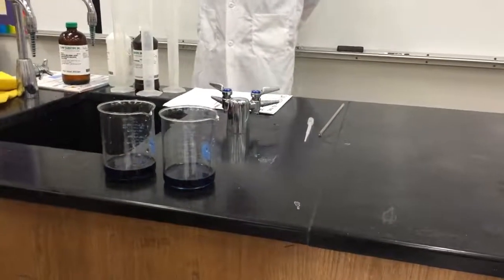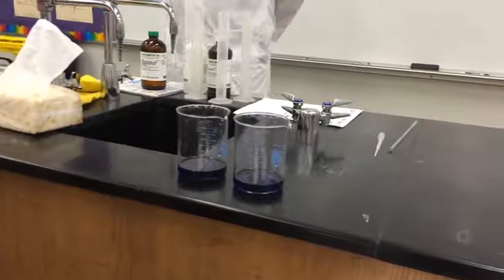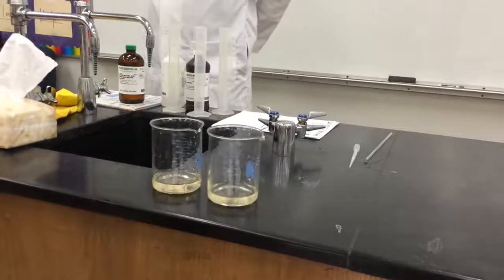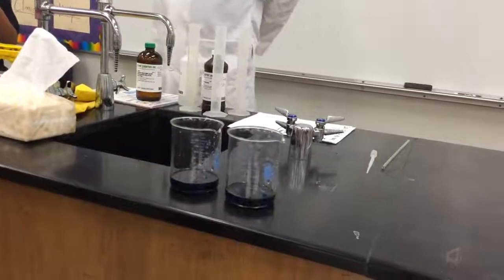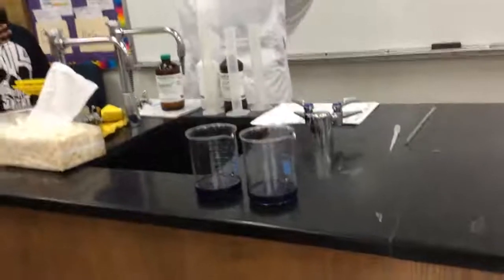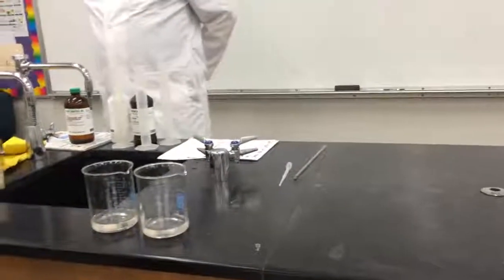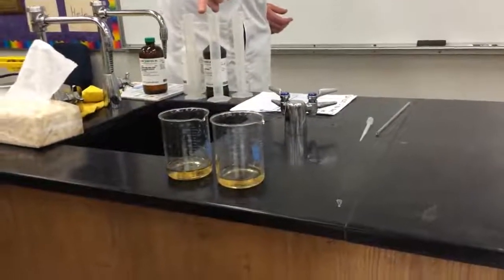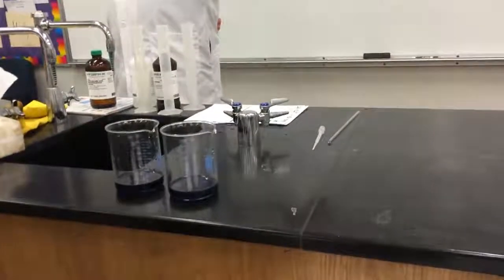See that? Now I'm going to give you a little clue. There's starch in there, in the malonic acid. And when starch is dancing with iodine, it turns blue. So what's happening when the solution is blue? Starch is dancing with iodine. What happens when the solution goes clear? What's iodine doing then? Dancing with somebody else, isn't he?